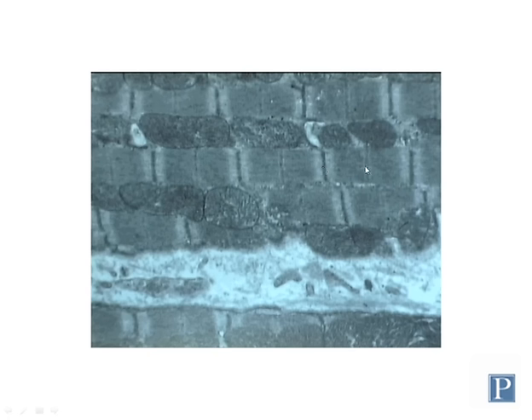If you look closely in the middle of the A band, which is this dark colored band here, you can also see some different areas in the center that have different electron densities. So in the middle of the A band, there's a lighter region which is called the H band or H zone. And in the middle of that, there is a darker line which is called the M line.